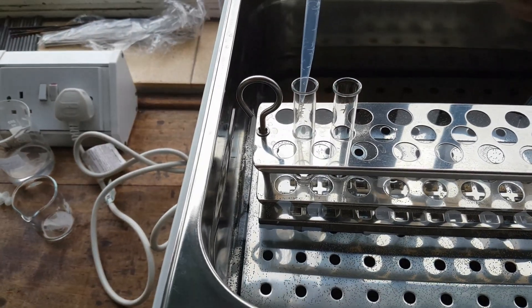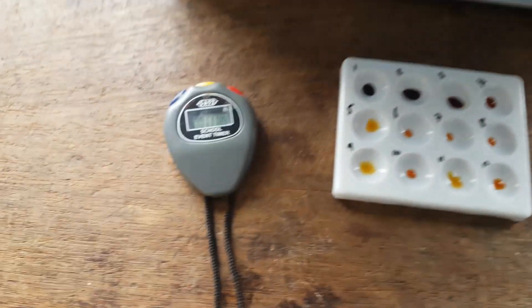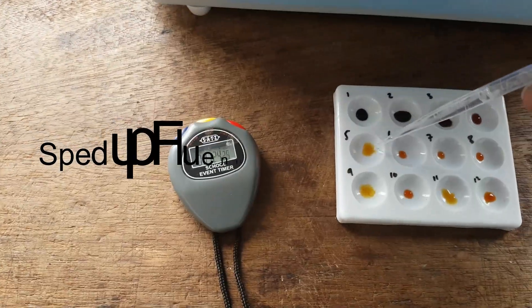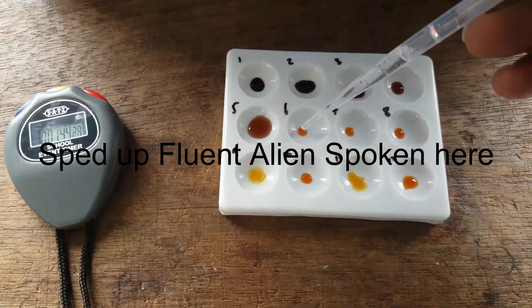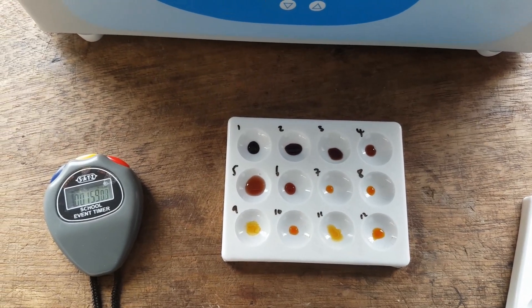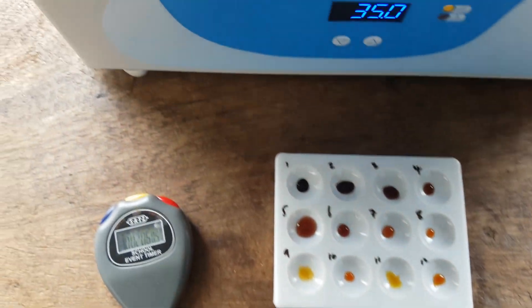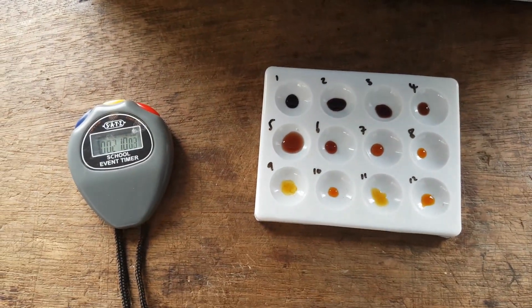and put the remainder back in. Because we don't want the temperature to be affected, so we need to make sure that it's back in. So I'm on my 7th well now. So it's another 20 seconds, so I'm going to take that out, put a drop on. And it's changing color less and less and less. In fact, I think by the 8th one, we might be done here.